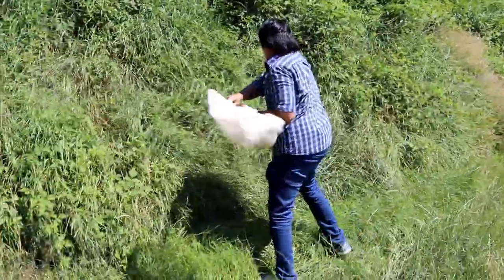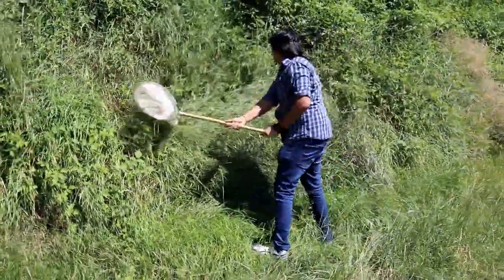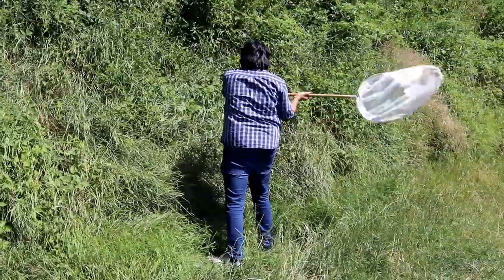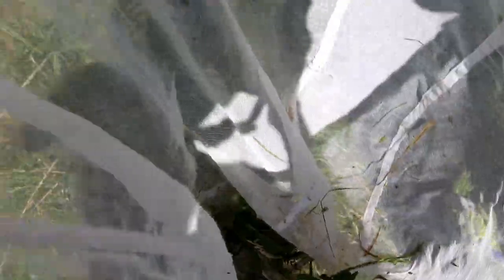You also collect a lot of grass seeds, leaves, and things like that, which makes it a little bit more difficult to find the insects. You can see now there is some plant material caught in the net.